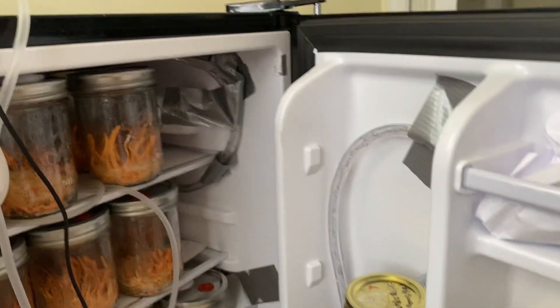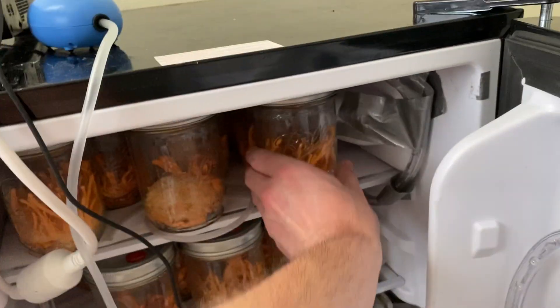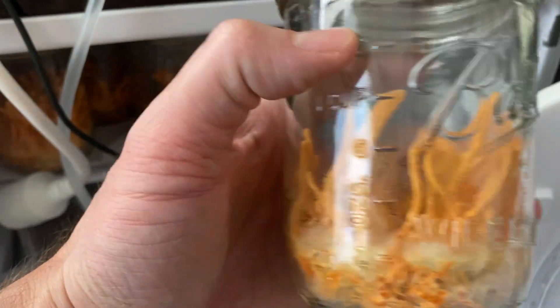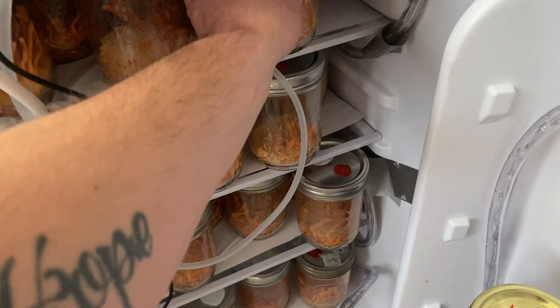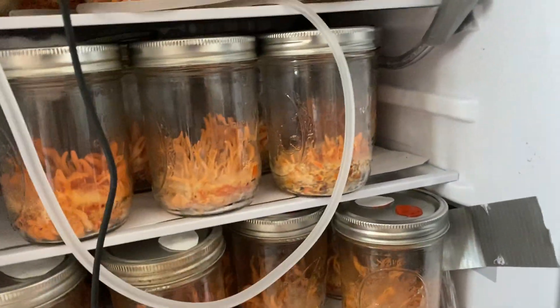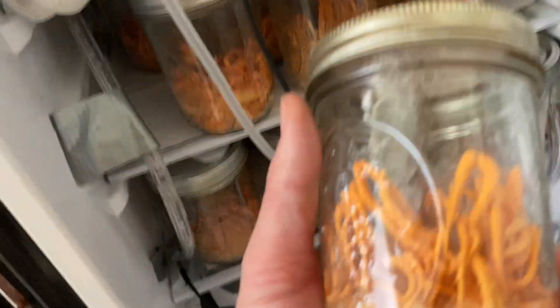I'm testing about eight different strains right now, and the best one I've found is probably this guy. You can see this is a pretty good jar — it's over a cup, about half full with fruits, and you can see there are spores on there. It'd be cool to mess around with those once I harvest them. There are a couple of jars that aren't doing too well, but I think that's just because I was doing a lot of trials with different strains.